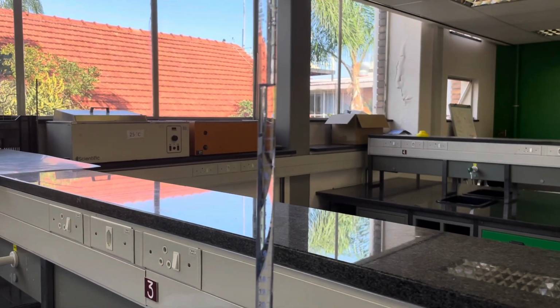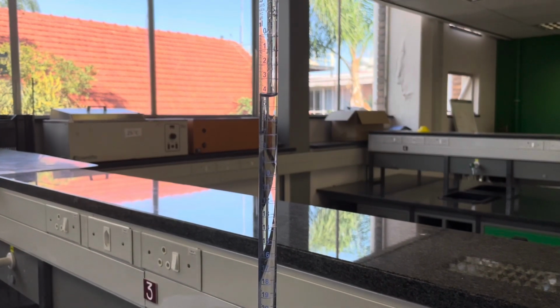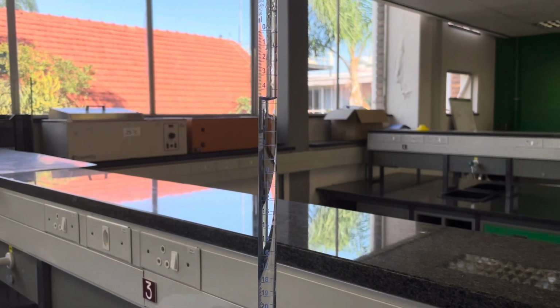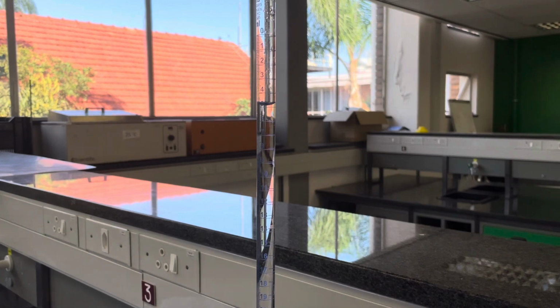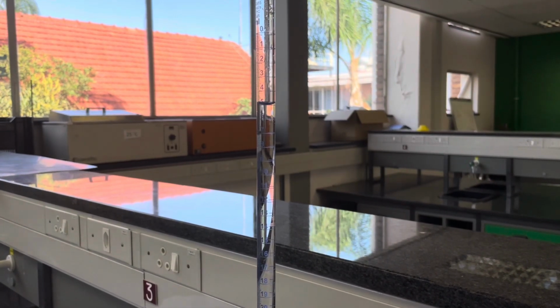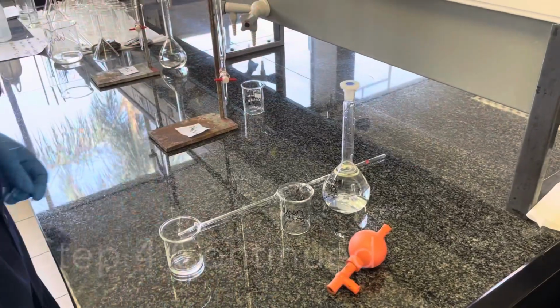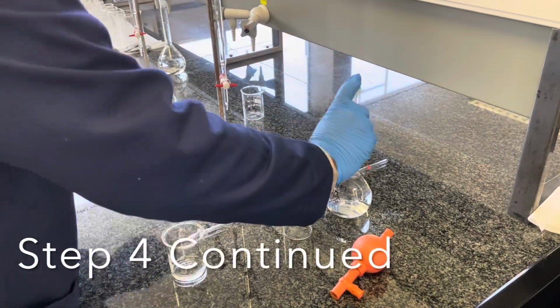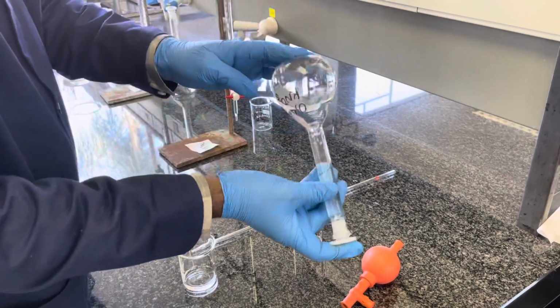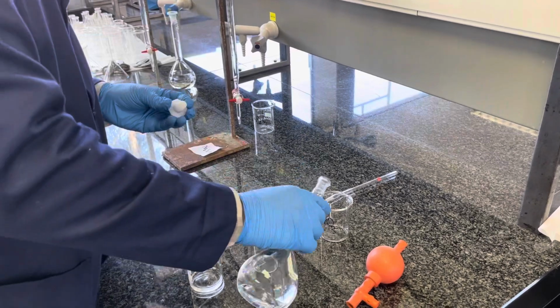Remember, the bottom of the meniscus needs to lie on top of the line indicated in the Buret for you to have an accurate dispensing of that specific volume. Here you can see we've dispensed 5 milliliters of potassium iodide solution accurately, since the bottom of the meniscus touches the 5 milliliter mark. For the potassium nitrate solution, you will be using a 10 milliliter pipette to accurately dispense 10 milliliters each time. To start off, remember to homogenize all your solutions before measuring.